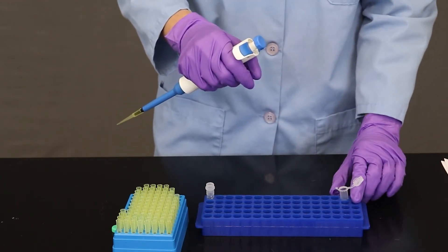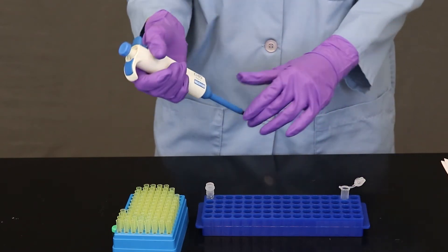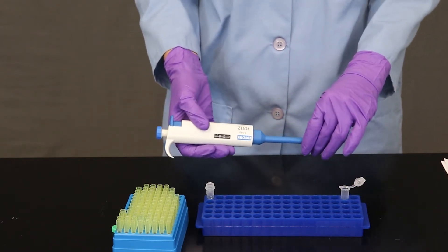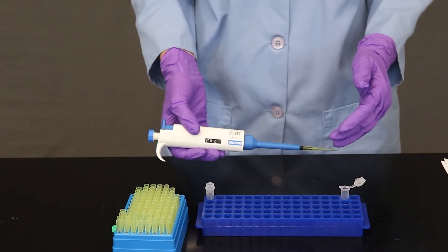So I'm going to hover over my proteinase K and open my microfuge tube with the insect tissue. And you'll notice that I'm wearing gloves. That's really for two purposes. One is to protect myself from any harsh chemicals. But the second is to avoid contaminating the DNA sample with my own DNA.